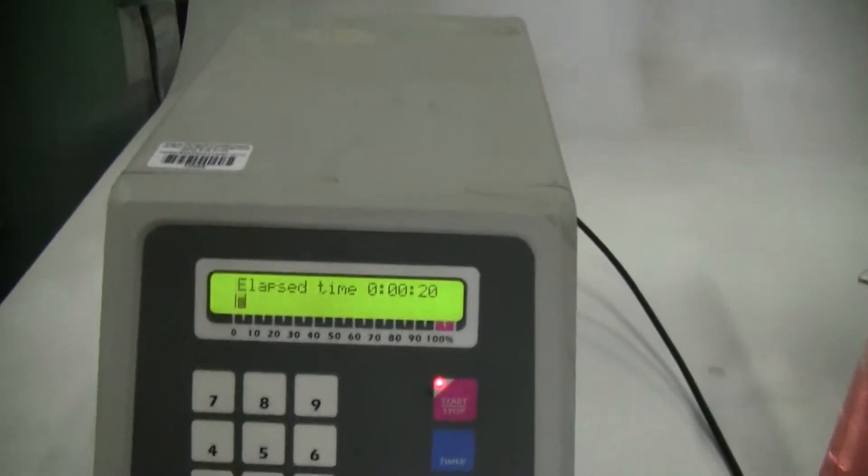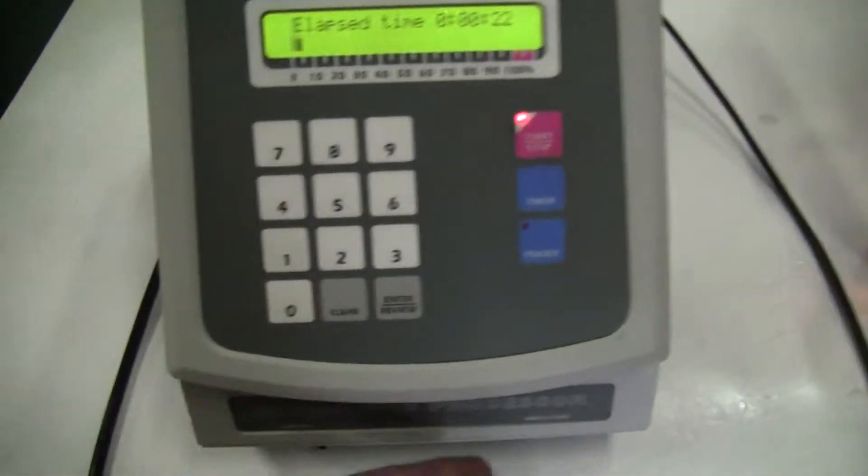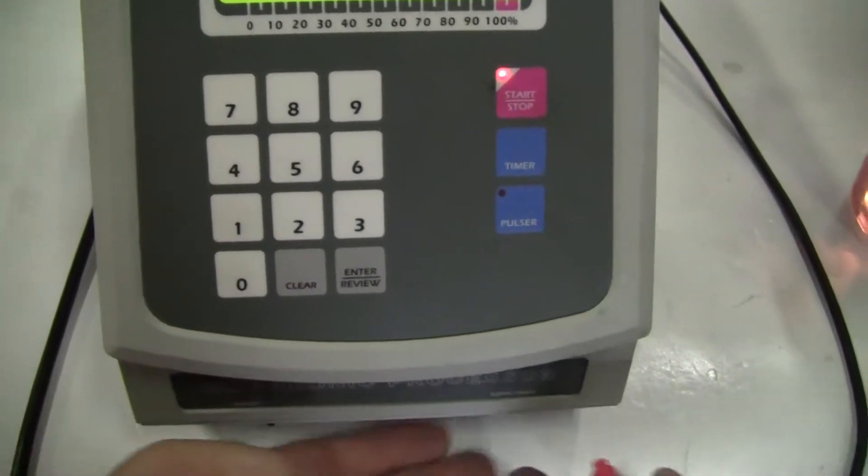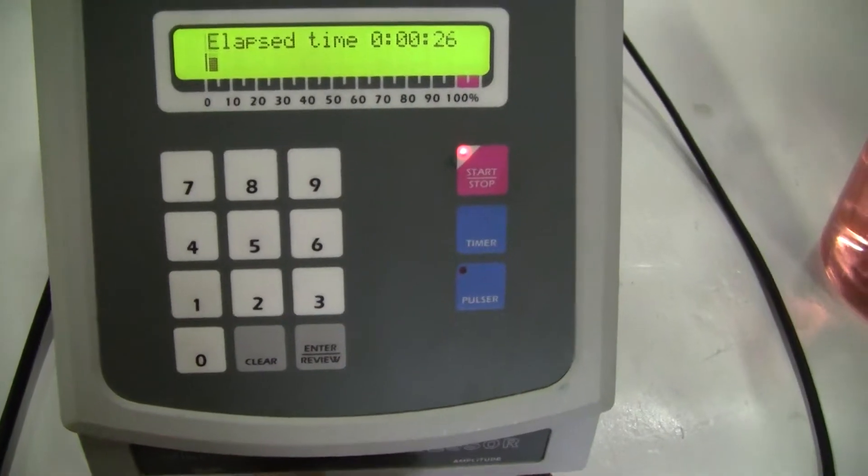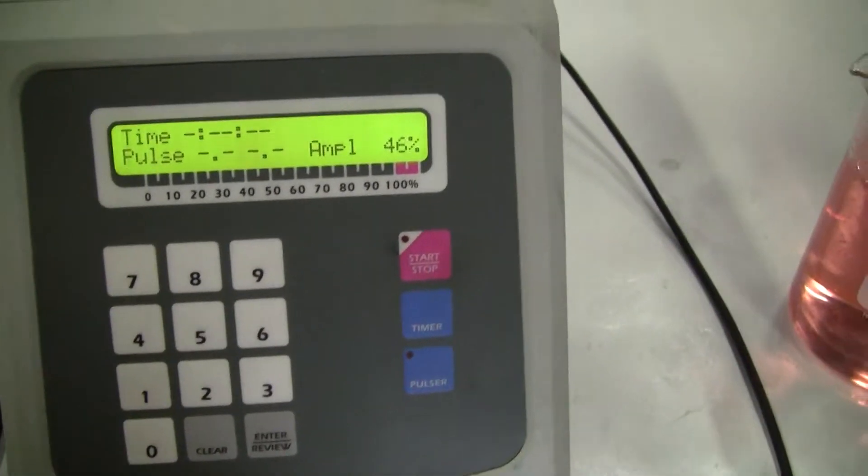So there you have it. Let's talk about the timer going up. We'll increase the amplitude. That's it. We're showing elapsed time. There we go.